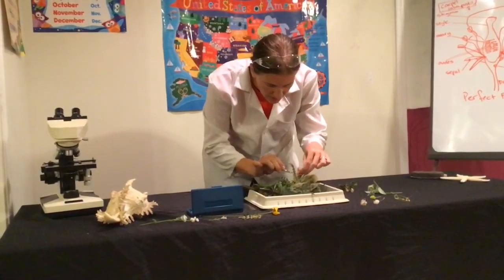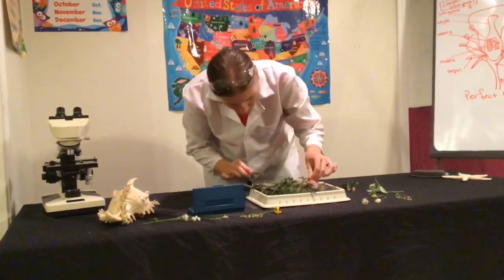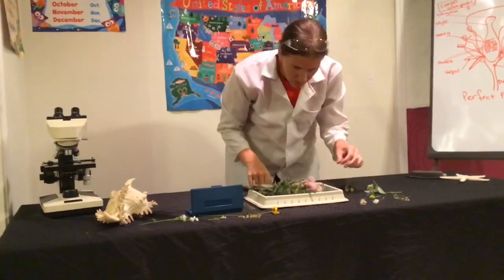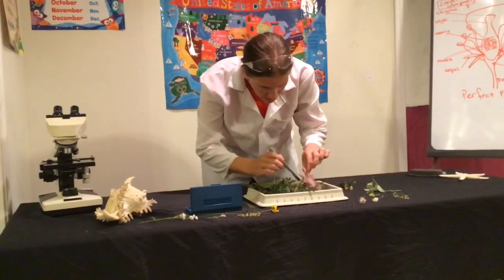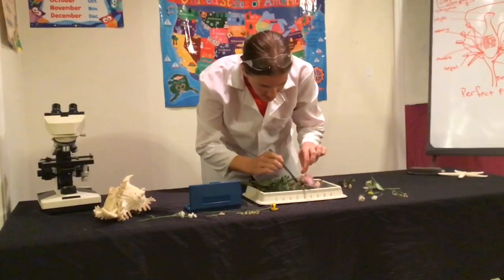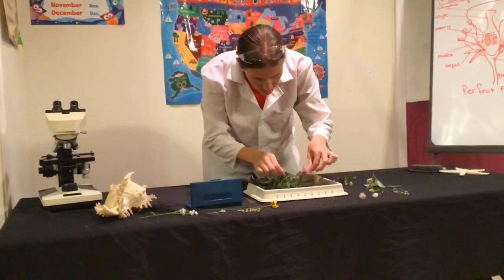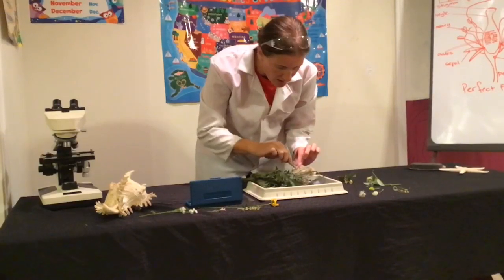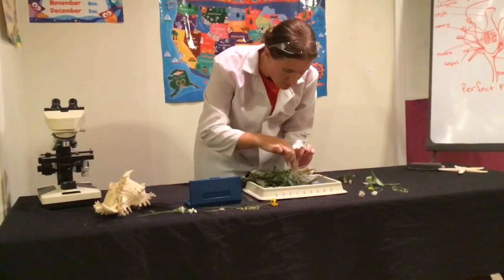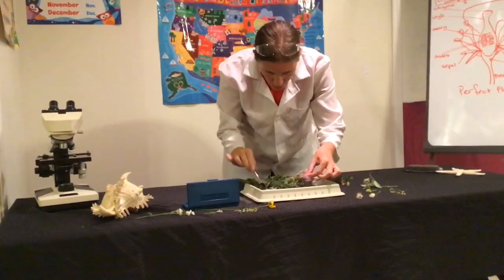These are all the little individual seeds that are going to come out. Not sure if I can get into seeing the ovaries on this one. You gotta be very careful working with these because they're a little sharp. Maybe I'll just pull some of these off. Notice the sepals in this case are covered in thorns, as is most of the plant. I'm going to pull them off so they're less likely to hurt me.